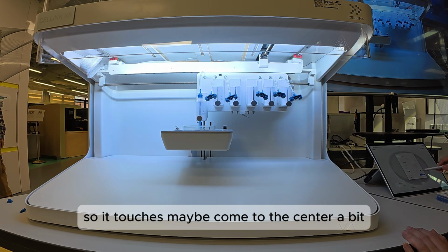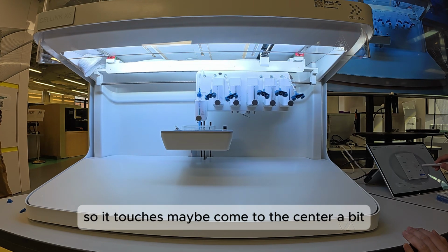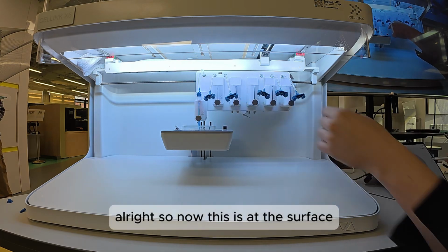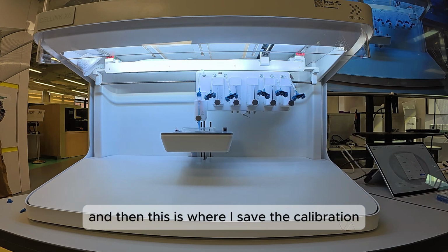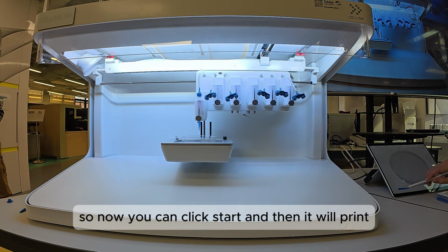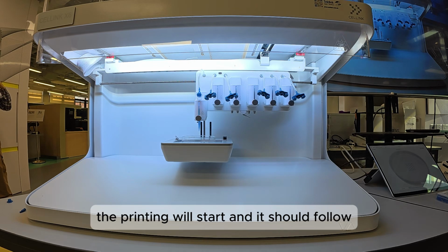Okay, so it touches. Maybe come to the center a bit. Alright, so now this is at the surface, and then this is where I save the calibration.